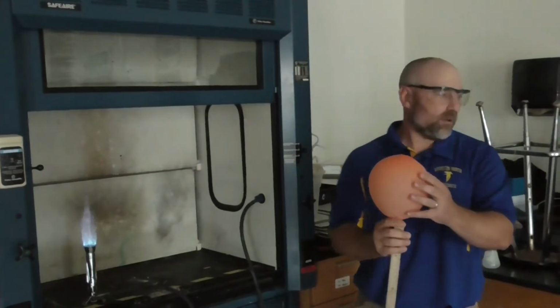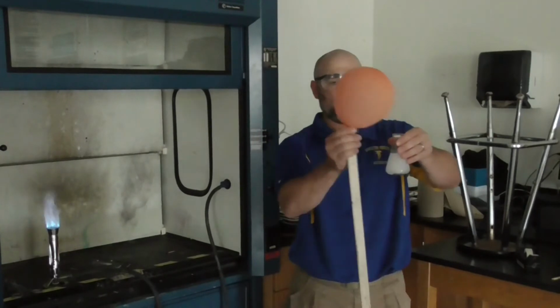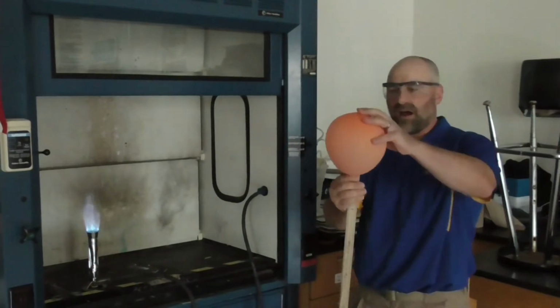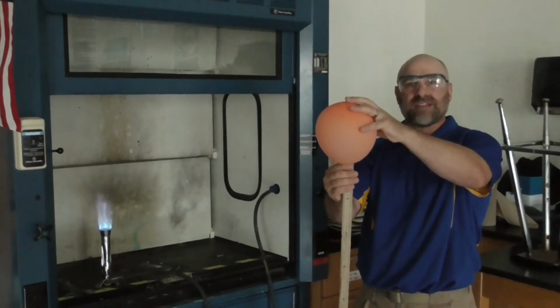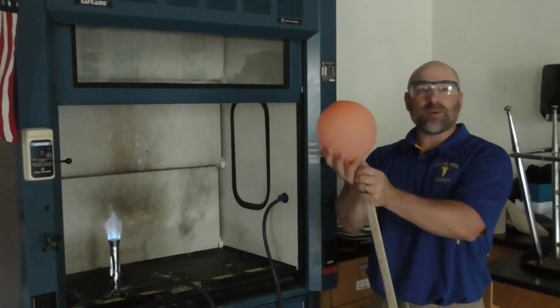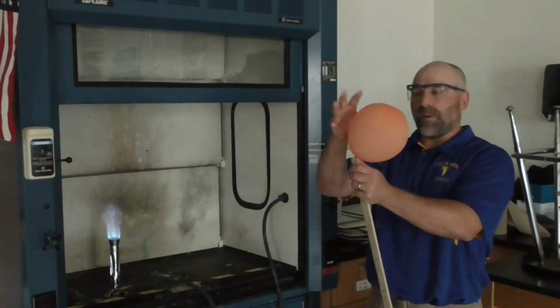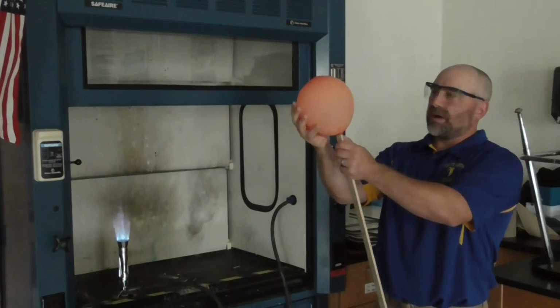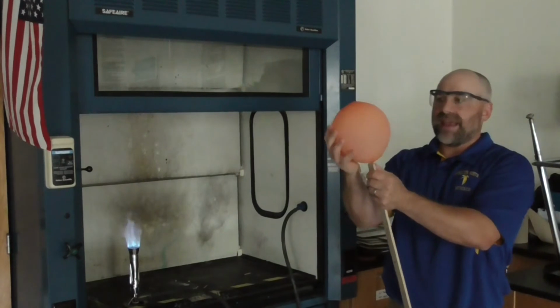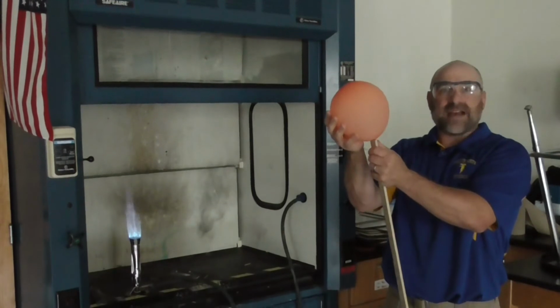Okay, so what I've done now is I've taken the hydrogen gas that was trapped as a result of this reaction. So I've taken the balloon off and I've simply taped it to a meter stick. So this is now filled with just that hydrogen gas. Interestingly enough, for those of you that study history, this is what happened in the famous Hindenburg Explosion, also on the cover of the Led Zeppelin 4 album. But what happened in that particular tragedy was they filled this gas into a Zeppelin or blimp. And because it's lighter than air, less dense than air, it's a good flotation gas.